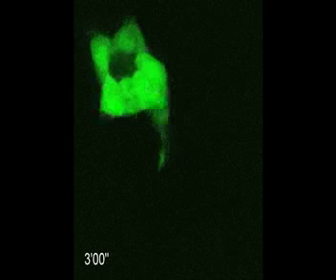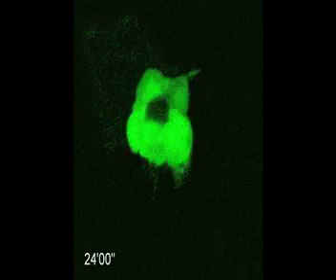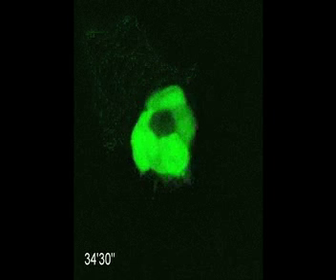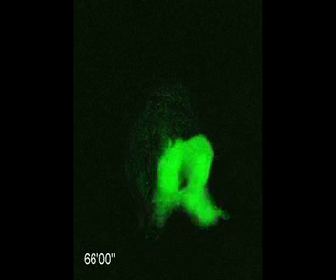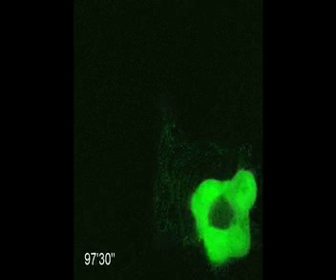This is a cluster of 4 or 5 cells around the outside surrounding 2 cells in the middle that are dark because they're not expressing the fluorescent protein. The green cells that we can see here are the migratory cells, and they extend and retract protrusions, and we can even see them changing position so that the leader cell is not always the same.